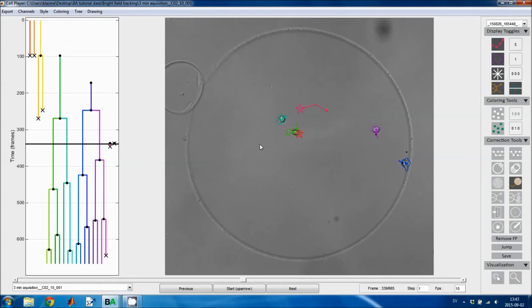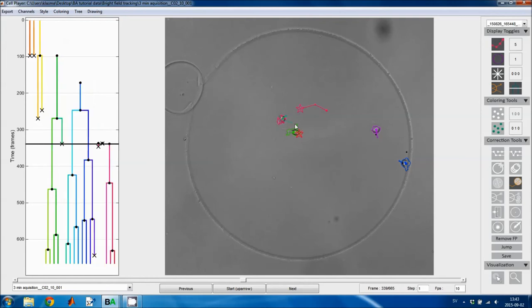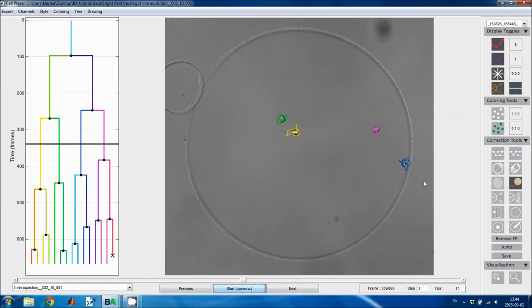I was going to show you the track split tool again. So I click on one region on the center point of the previous image, and then I click on the region that I want to copy, or the cell that I want to duplicate. It's duplicated from the current frame onward. And then I think I'll actually reload the tracking results because I've created so much garbage here.